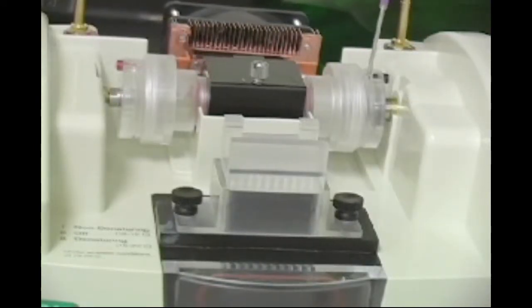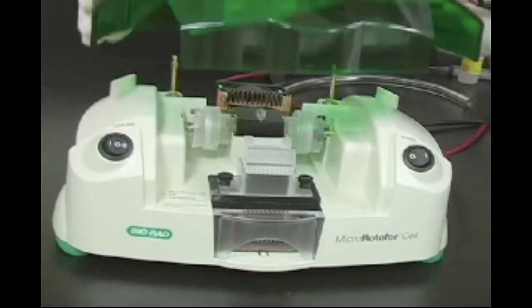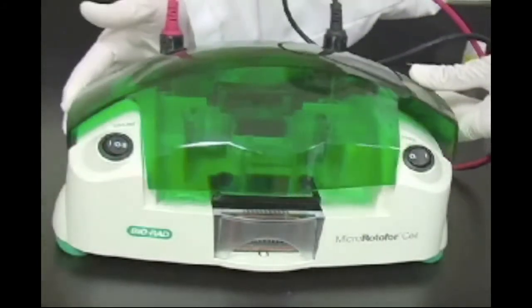Using a different 10 milliliter syringe, add 6 milliliters of 0.1 molar sodium hydroxide through the vent hole of the cathode or black assembly. Place the lid on the cathode assembly. Place the lid on the chassis.